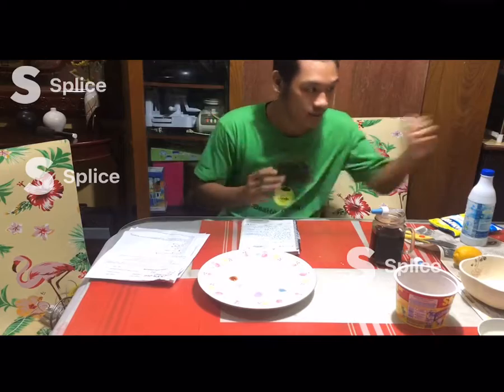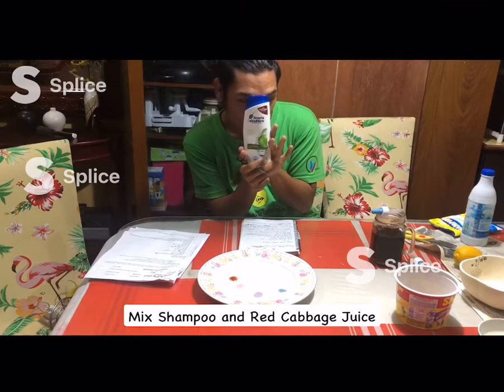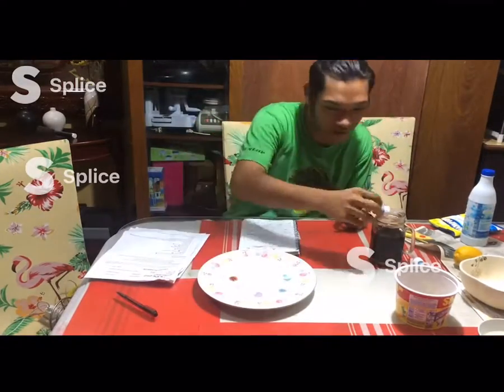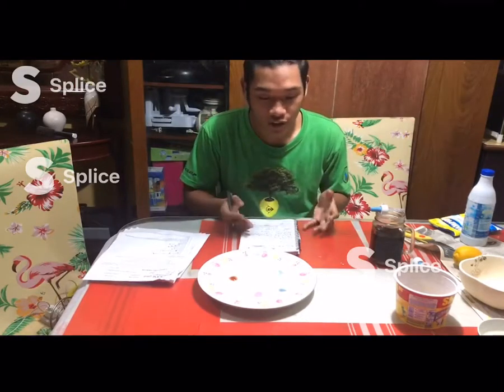So next, I will mix shampoo and the red cabbage juice. I notice when I mix the shampoo and the red cabbage juice, nothing happened. Same blue color.